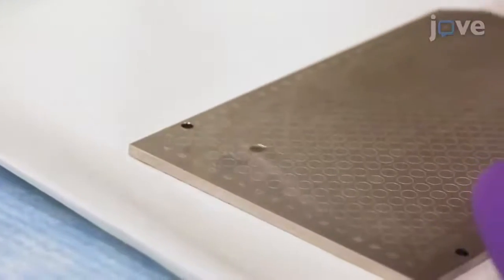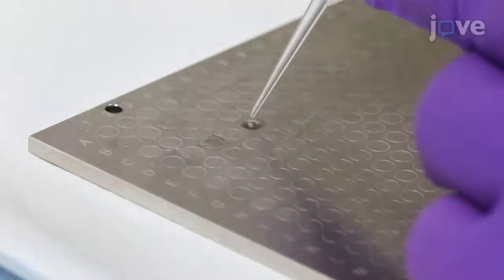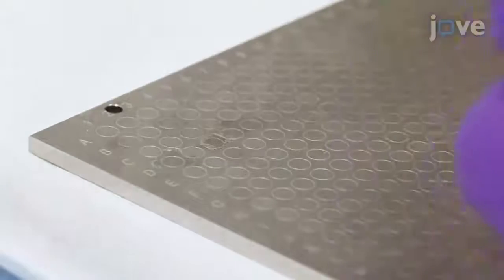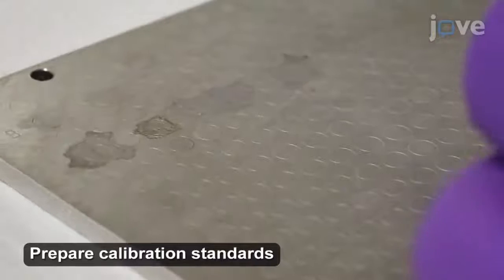Pipette 1 microliter of each solution mixture onto an individual sample well on a MALDI target plate. Add the samples incrementally in small portions to prevent the sample from flowing out of the sample well, allowing each aliquot to evaporate to dryness before adding additional sample.